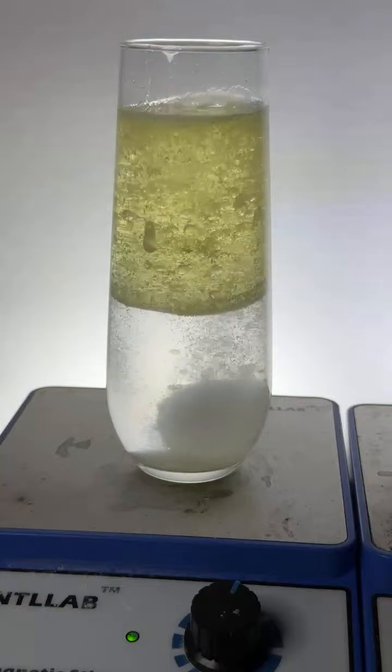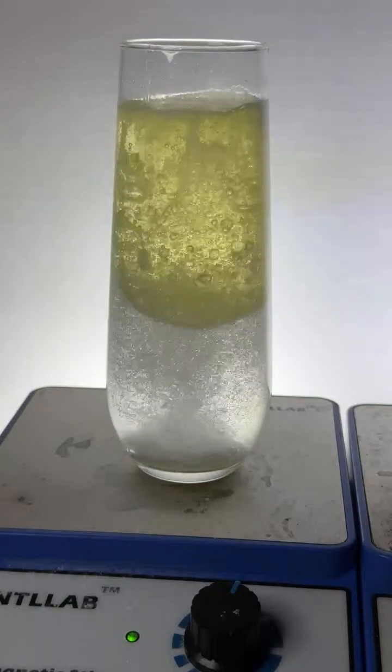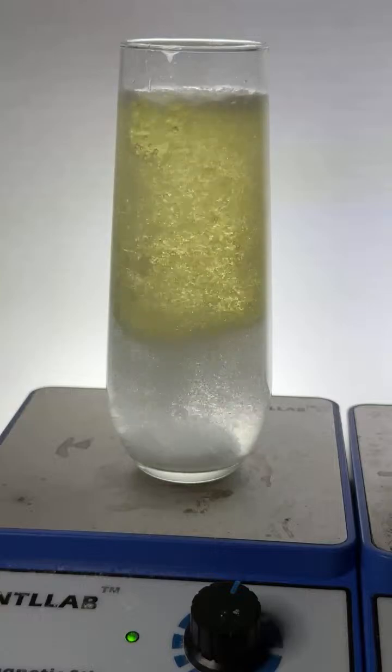Three at once. Rubidium. So, Administrator, I did put rubidium in water. I've done that experiment twice. Both times it broke the beaker. And one time it actually burnt my desk.